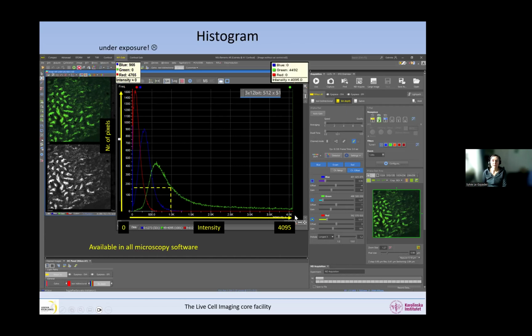And then if I look at my mouse here, I can see that in the green channel, lots of pixels are saturated, but not in the blue and red. So there is saturation in my images. And also I can see that most of the photons that I'm collecting are in this part of the range, and the rest of the intensity range is not used with the blue and the red channel. So this is not very good.